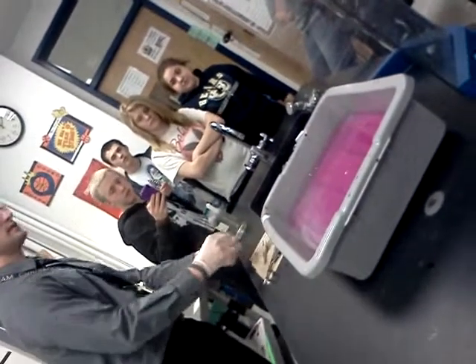Anybody ask? Do we need to get behind it? Back. Oh my God! Open the door. Whoa! Put the whole bar. That was good. That was not fun. It's not silver colored Play-Doh, it is sodium metal.